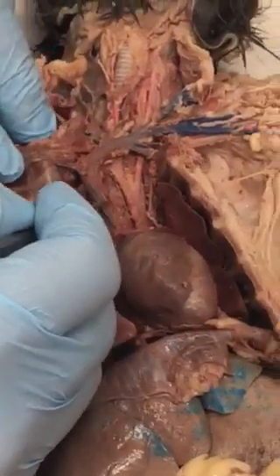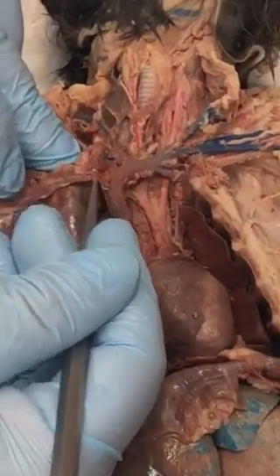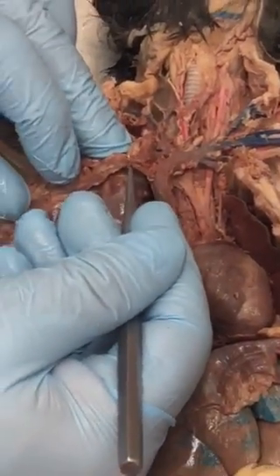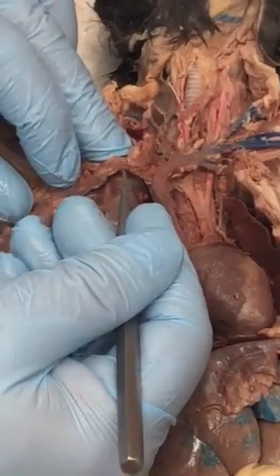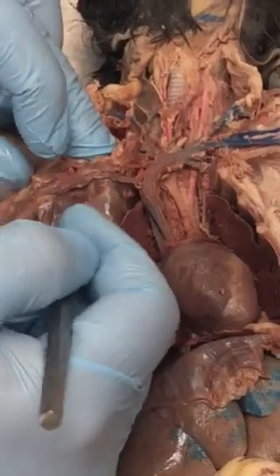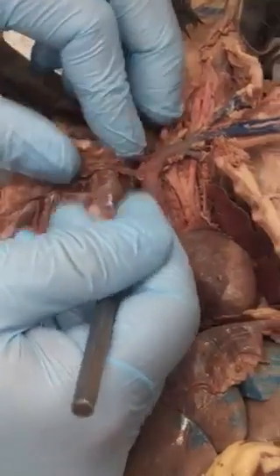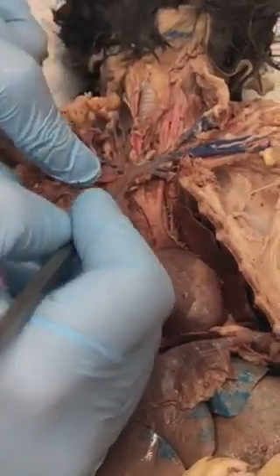This comes up here. Now there is a little branch right there — that's a mammary vein. Now there is a mammary artery that runs parallel to that, though I don't see it.